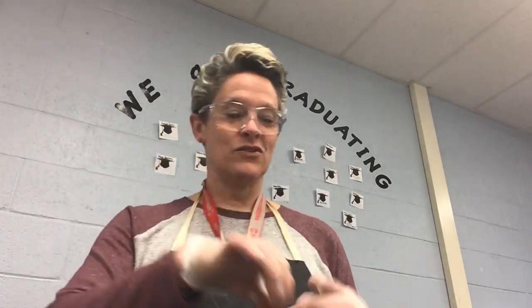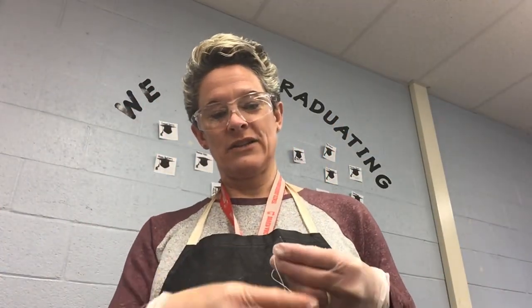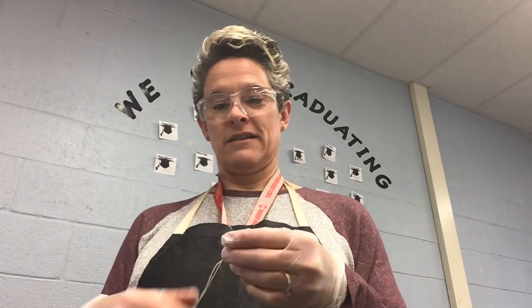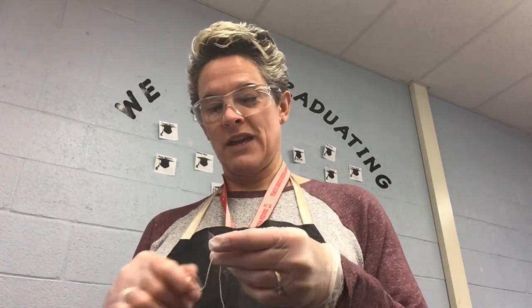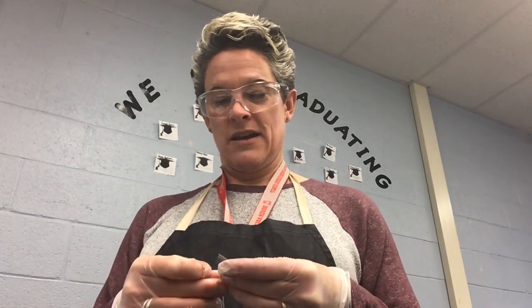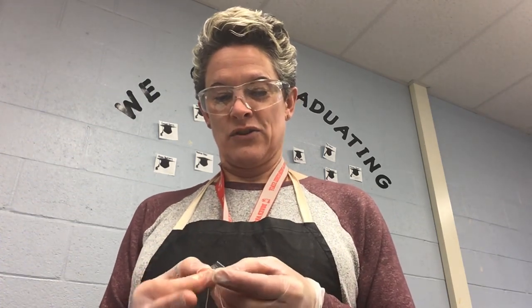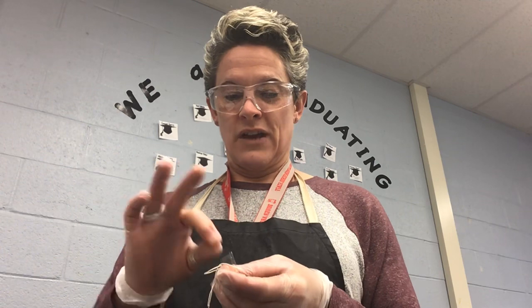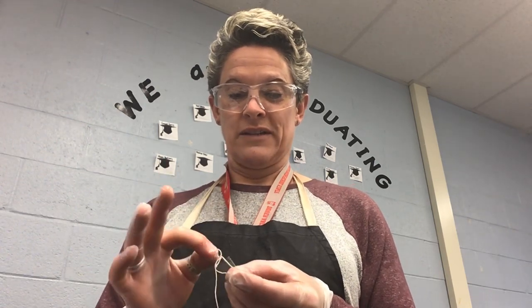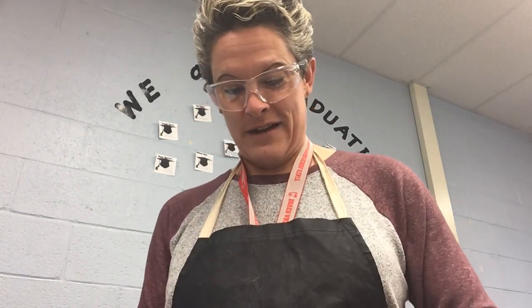So I'm going to attempt to do this. I usually have someone help me, but for dialysis tubing, we need to tie it off at the bottom. So you get to watch me struggle with this because I don't have someone to help me. I'm going to try to tie a knot in the bottom of this dialysis tubing, slowly but surely. I know you guys all like to watch YouTube videos, at least my son does, but this is probably not the most exciting YouTube video that you've ever watched, so I apologize for that.